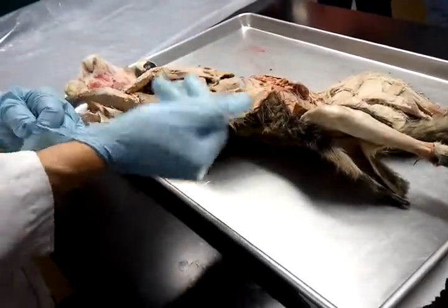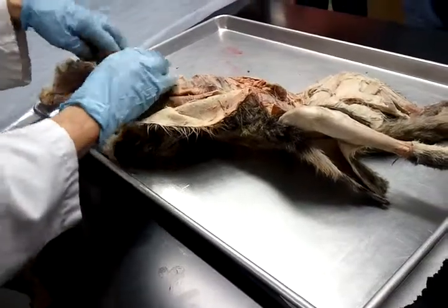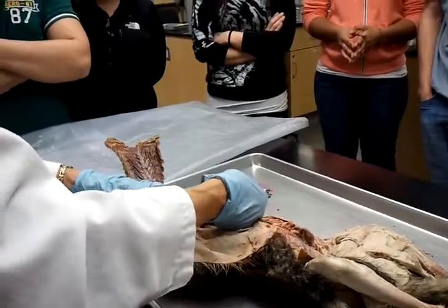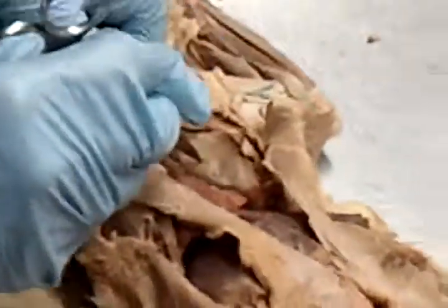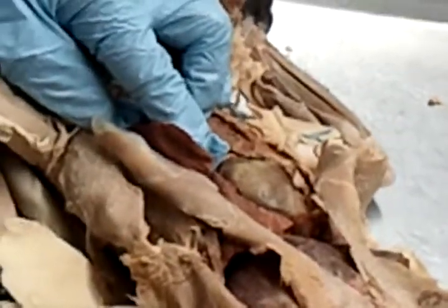cavity, which we know we access by cutting a breastplate and then elevating that up and going into the thoracic cavity. And then there's that fibrous pericardium right there. See the loose fitting sac, the undersurface of which is the parietal pericardium. But then the heart wall itself, everyone understand that phrase, the heart wall itself doesn't include the cavity.